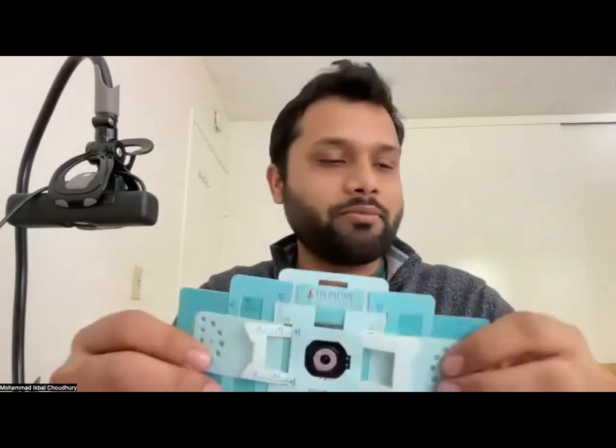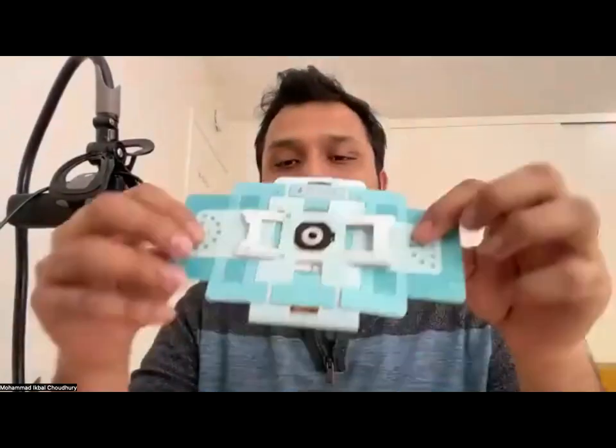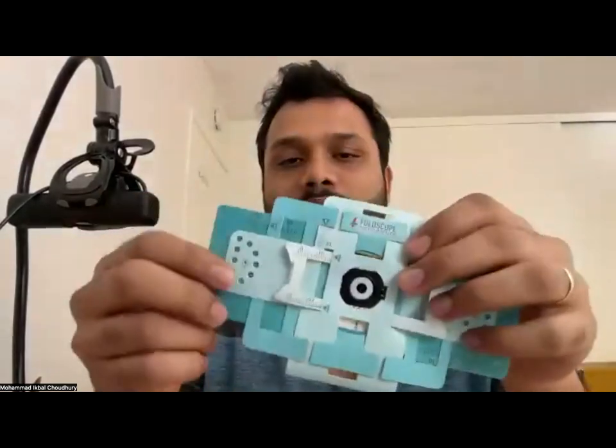And you can follow what I'm doing, or you can just watch and try to see if you can do it on your own. So primarily, let me see. Okay, I'll keep switching between this camera and that one, and that should work. I can't find my phone, but it should. So that's our foldscope, and it has a bunch of components in it.